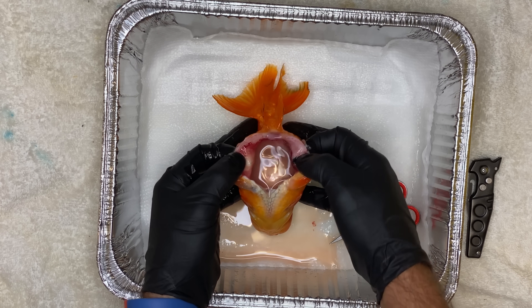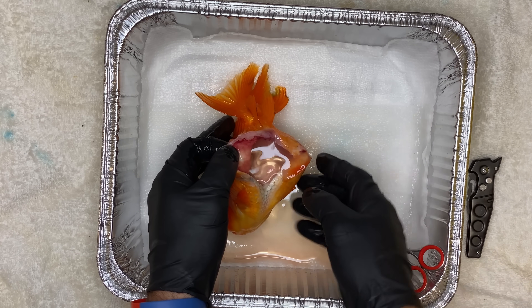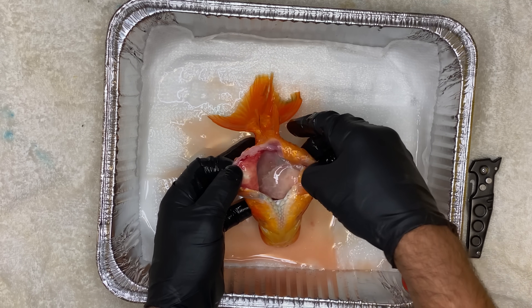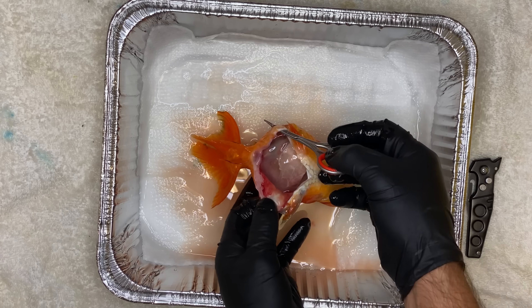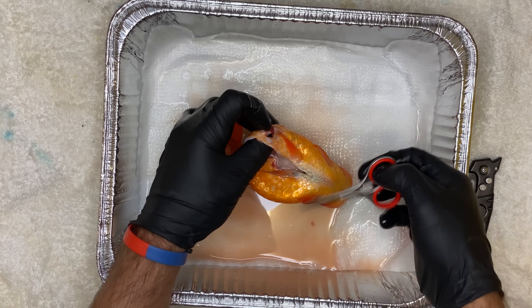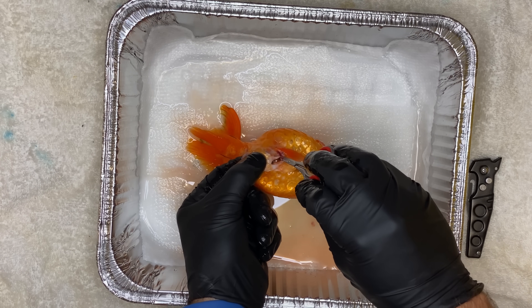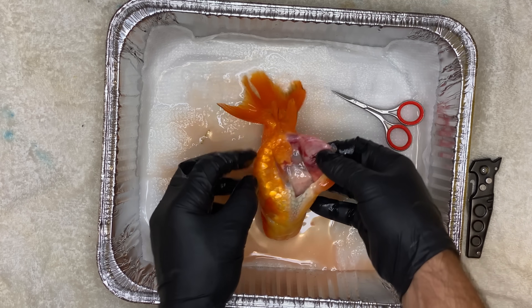This appears to be a normal case of dropsy, where the body fills with fluid. However, there was no pineconing of scales, even late, late stage into the disease. And what you can see right here is that there was actually a fistula on the body — her body actually ruptured, which allowed a way for that fluid to vent out. But this is not a typical case of dropsy. I believe this was caused by other things that I'll get into later in the video.